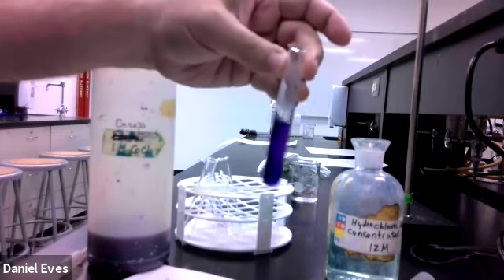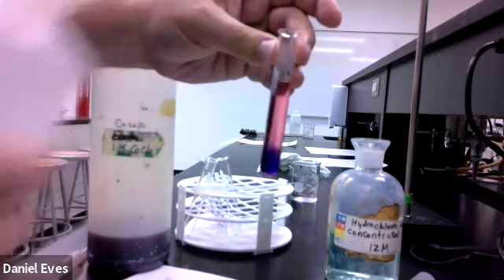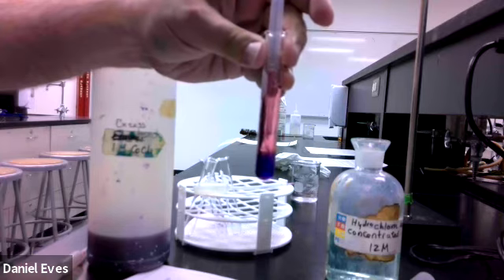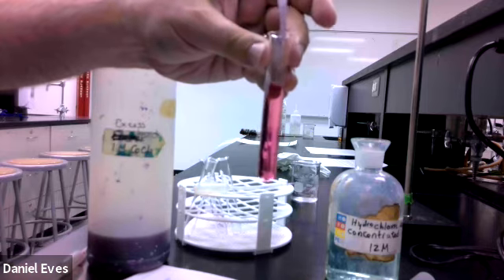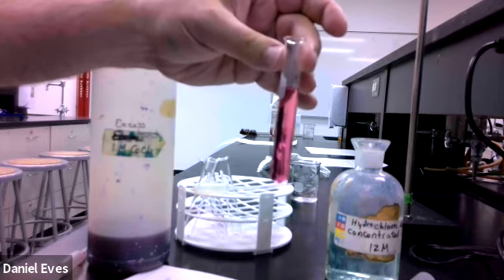Okay, and then just one more time, just to make sure that we're doing it right, more water means red. So we're getting that all together, and we'll just go ahead and mix that up real quick so we can have it all be red. And if I wanted to turn it blue again, I would just add more hydrochloric acid, and that's the equilibrium back and forth, back and forth.